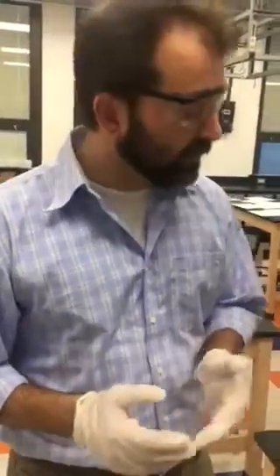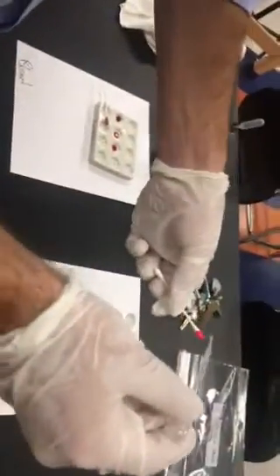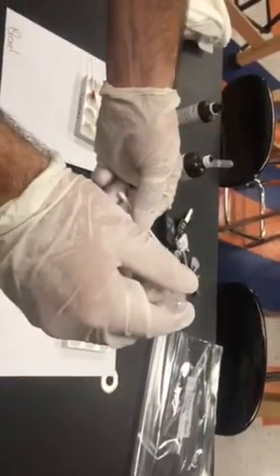One is called the Kastle-Meyer presumptive blood test. So let's look at our not blood, and let's say we have a sample of blood on a Q-tip, or a sample of something that's not blood on the Q-tip. What we're going to do is take what's called the Kastle-Meyer reagent and add just a drop or two to the Q-tip. Nothing will happen right away. We then take a little bit of hydrogen peroxide and add a few drops to the Q-tip. We're just going to let that sit there.